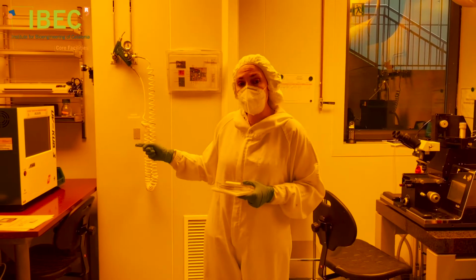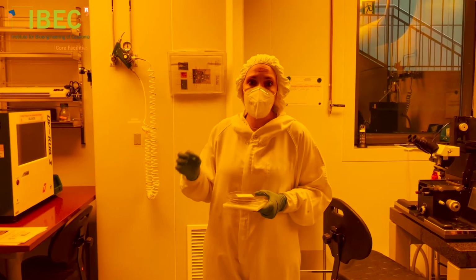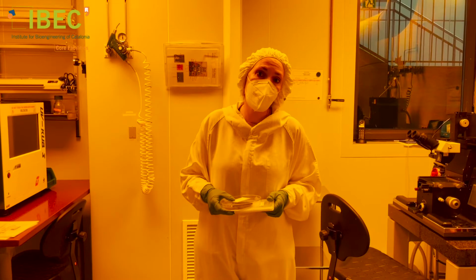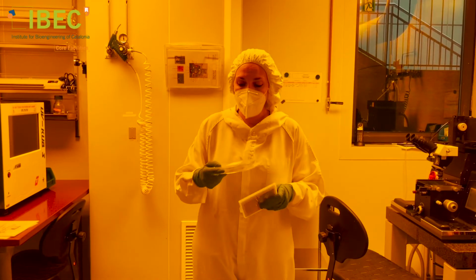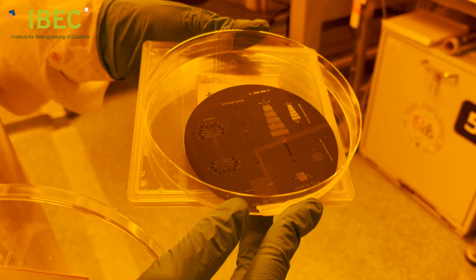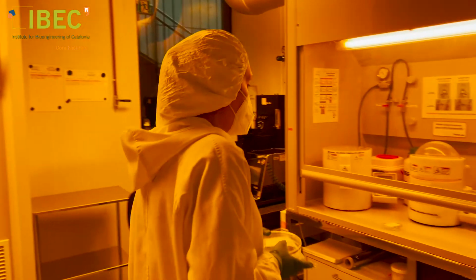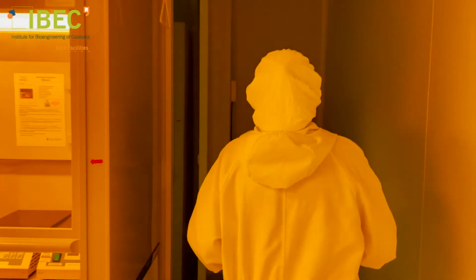And this one, instead of a lamp, has an LED, a diode, which shines on a single wafer. But also the result is the same. Transfer the pattern of the mask to the final substrate. And here you can see how we have the same pattern as before, transferred on a substrate. Let's go to the last part of the room.